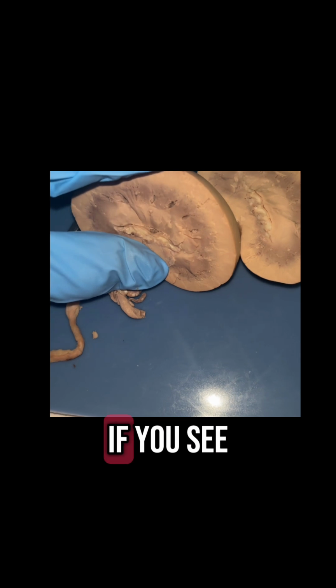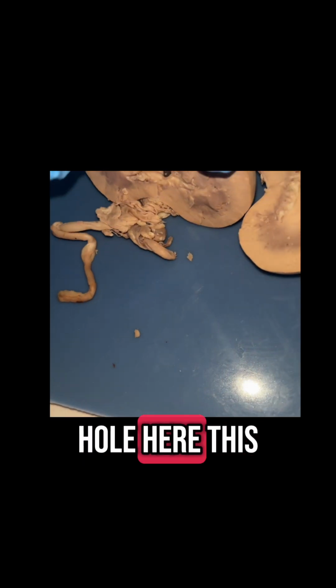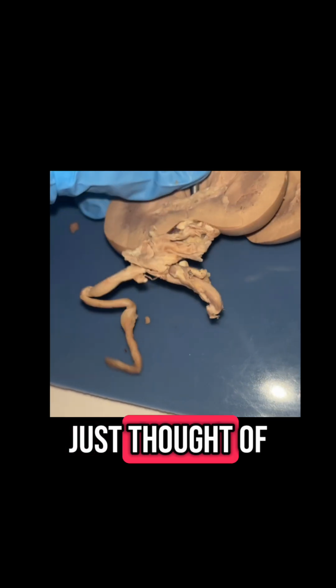I'm also going to point this out here too. If you see this hole, I'll use my probe to show it better. You see this hole here? This is actually the opening to the ureter here. Just thought that was something cool.